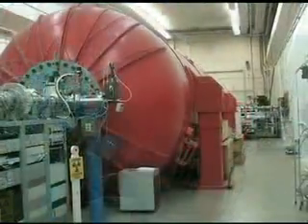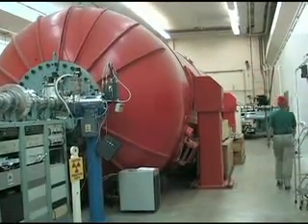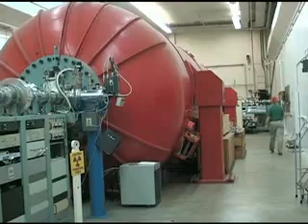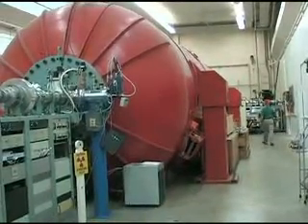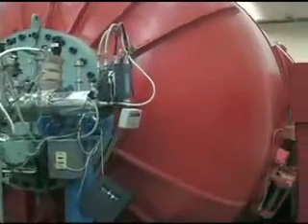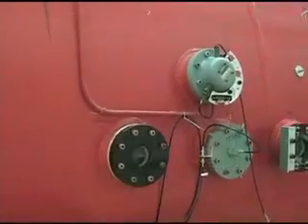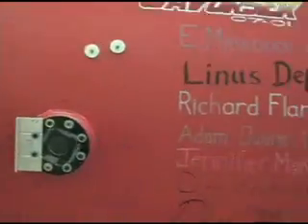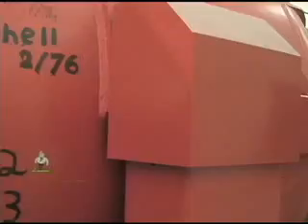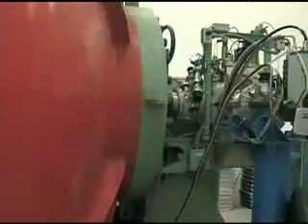This is the accelerator. A couple of things you might notice: the first is its size. The reason the accelerator is so large is because it is actually an insulator. Inside the accelerator itself is nitrogen and carbon dioxide, which serves as insulating material. What it's insulating are the accelerator tubes that run down the middle. If the accelerator is running at 7 or 8 million volts, the Beryllium-10, as it exits the accelerator, will have nearly 30 million volts of energy.